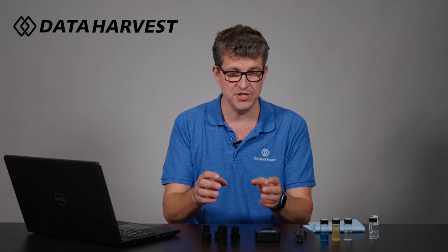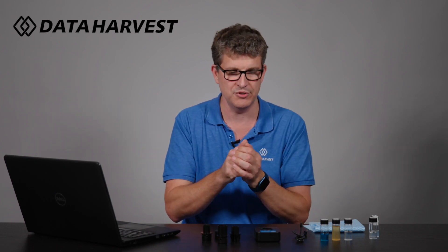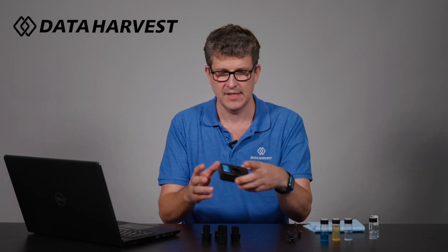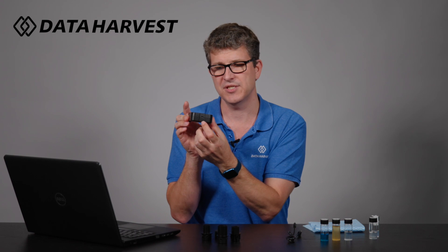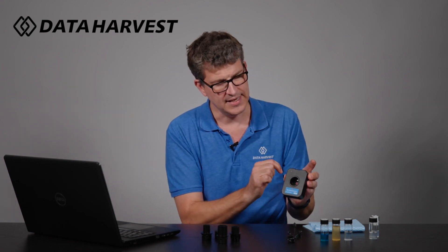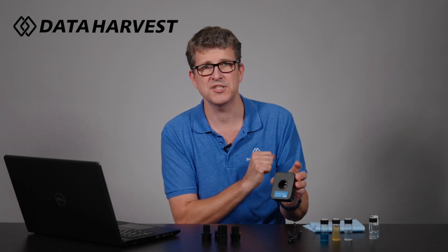To give you an idea of what's actually here, you do get five cuvettes with it as well. You know what cuvette light looks like so I won't show you that part. With the colorimeter you also get a USB lead on the back, and if we hold the button on the back for a couple of seconds it's now broadcasting Bluetooth — it's now flashing away and broadcasting.